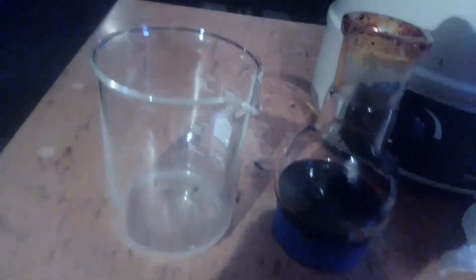After a bit of heating everything dissolved and now I am just going to pour it into the beaker.